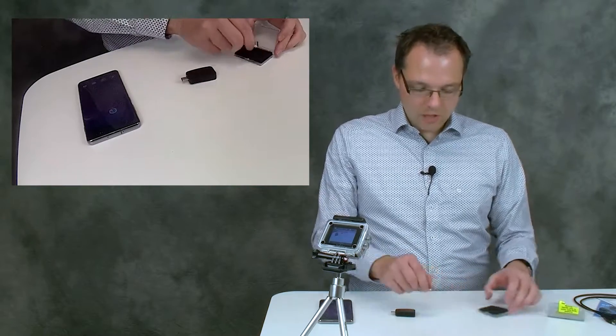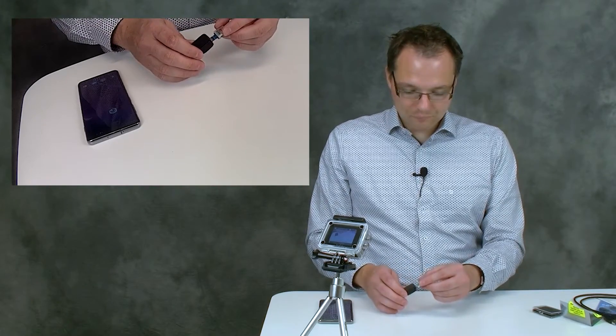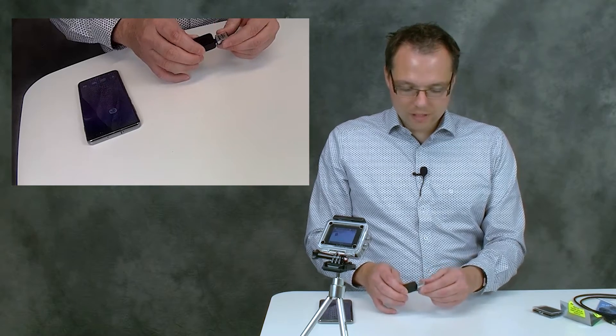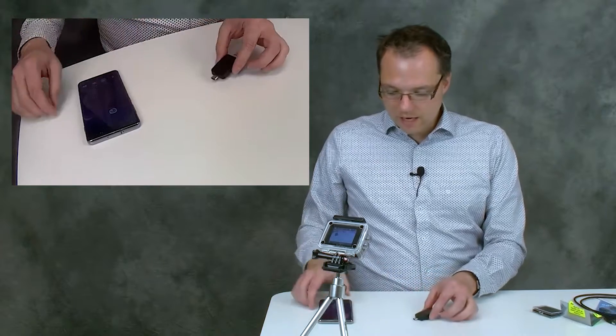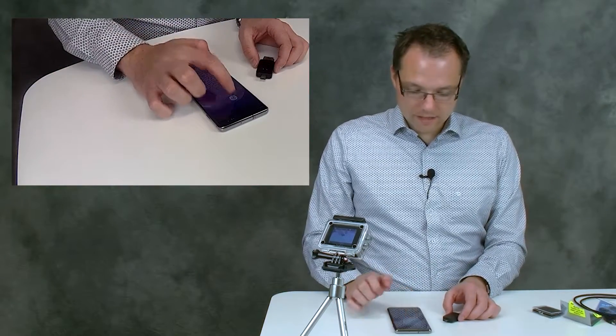But today we're going to use our dummy cell to do a measurement. For that, we just push the dummy cell into the front for connecting it. Then we take our Android device and start PS Touch.